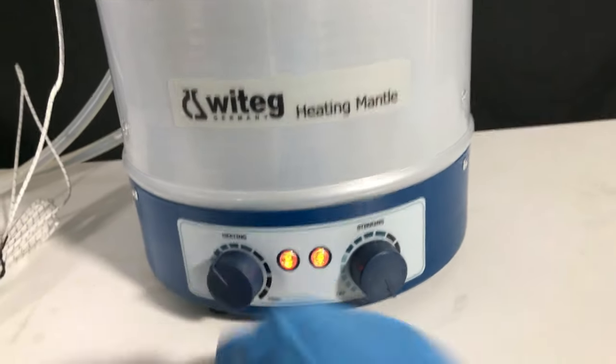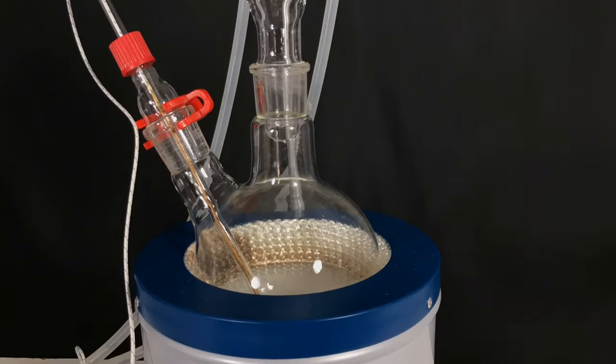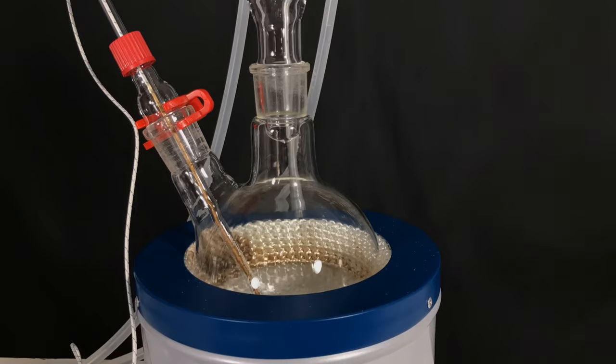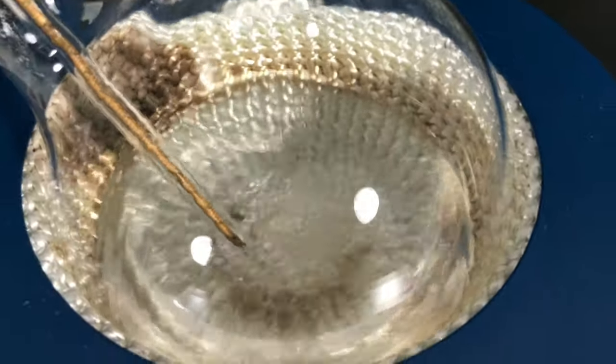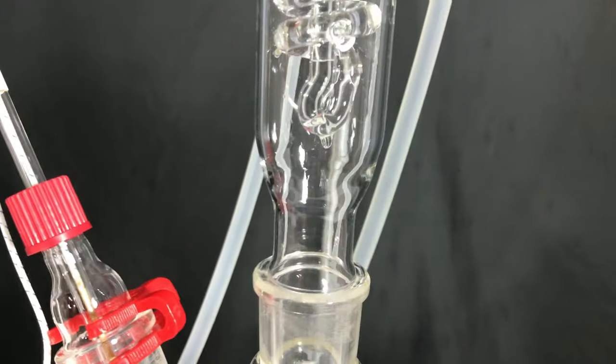Heating and stirring were turned on. This mixture was allowed to reflux for 20 minutes. In the beginning, all of the boric acid dissolved into the solution. Some of it got directly converted to tri-methyl borate.